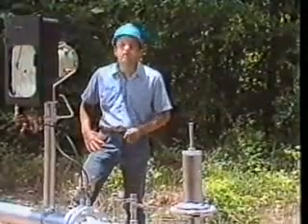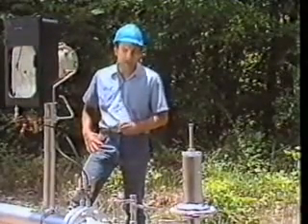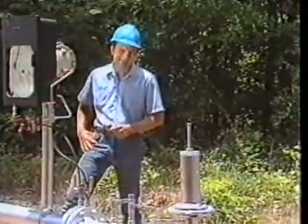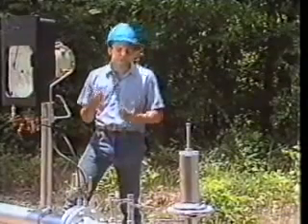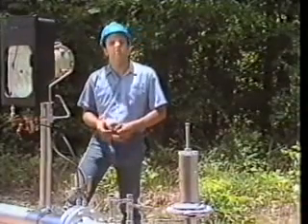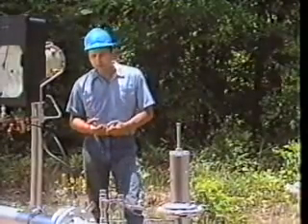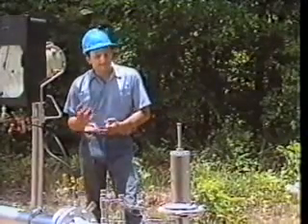Sampling into an evacuated cylinder is the most commonly used sampling method for gas and applies to both dry and wet gases. However, there are also several other methods which are applicable under certain conditions. These three methods are the evacuated cylinder method, the purge method, and the fluid displacement method. Detailed procedures regarding these methods can be found in the appendix of your student manual. For now, let's just look at each of these methods in general.